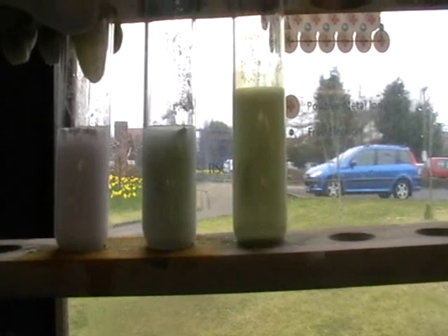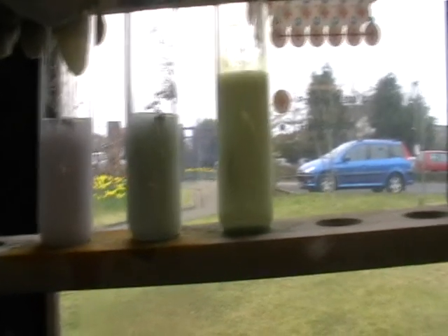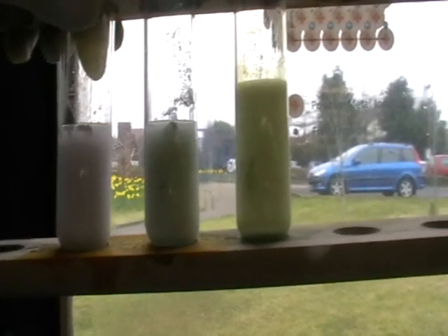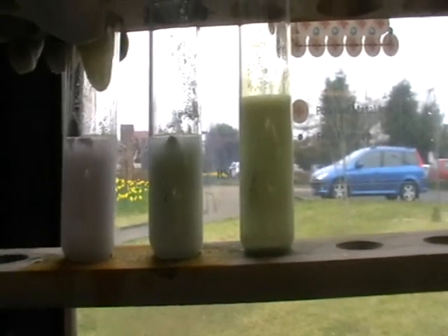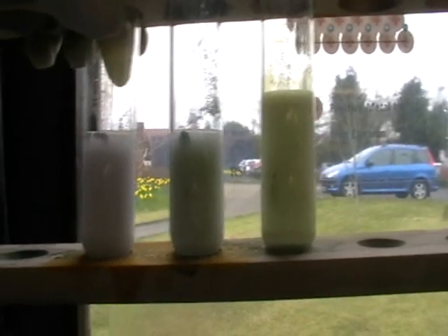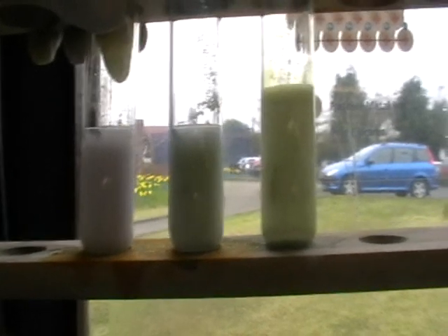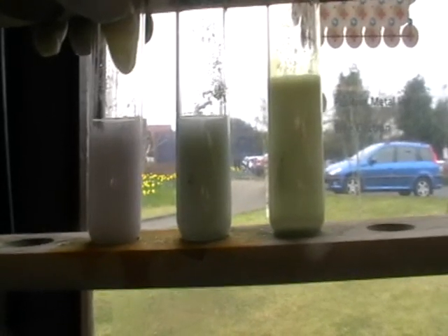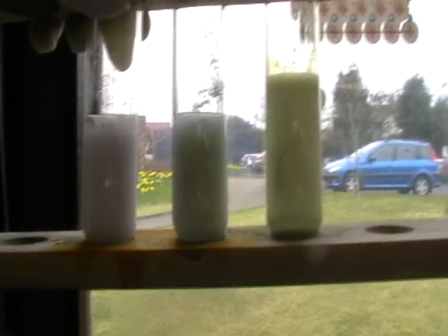The first two, the silver chloride formed on the left and the middle one, the silver bromide, they are light sensitive, so expect to see those darken. Indeed, it is silver bromide that is used in photography.